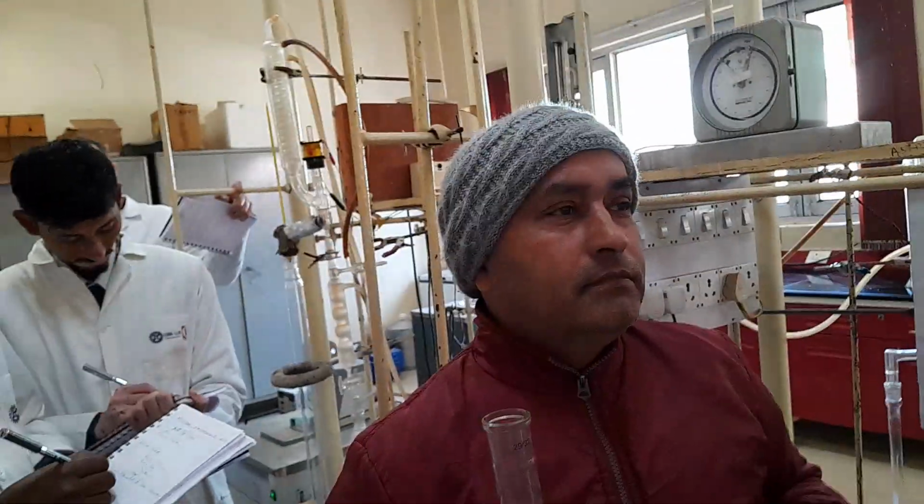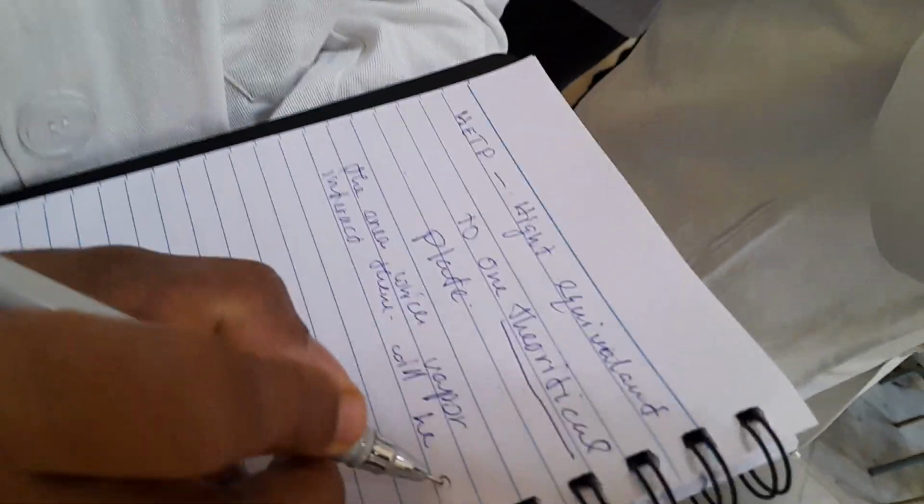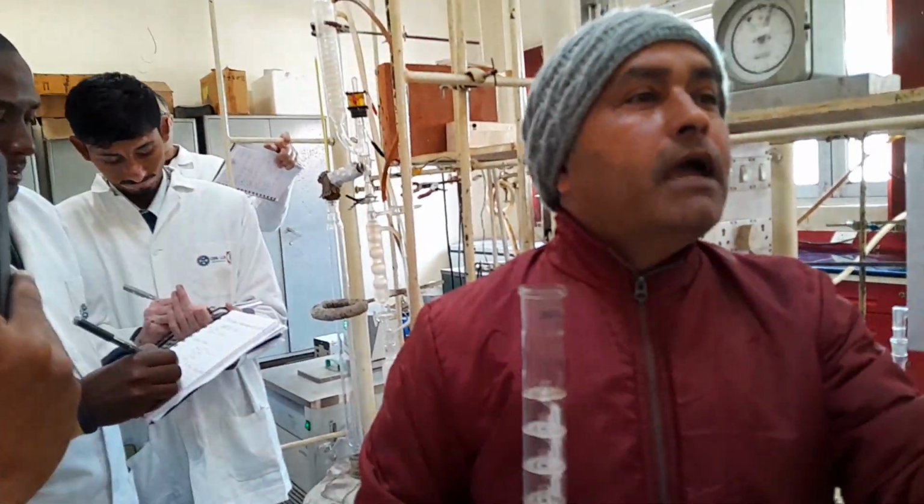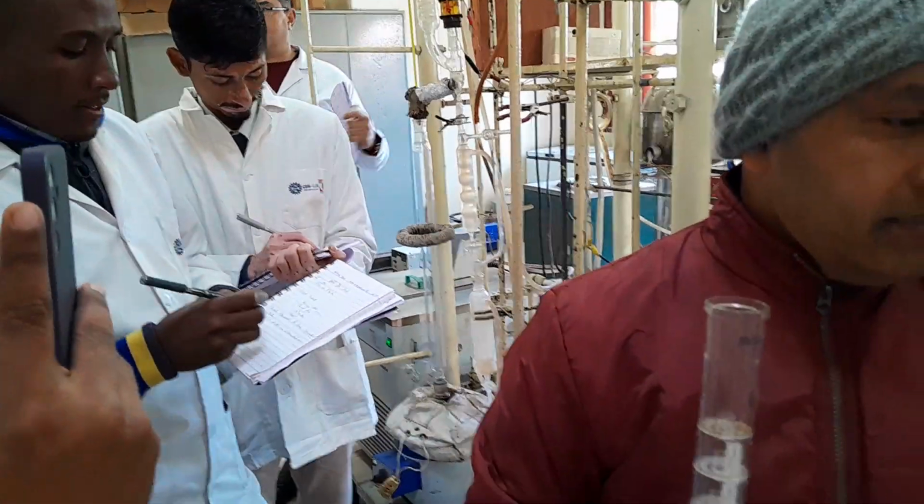Got my point? The area between two plates, the area where vapor and liquid interact with each other.